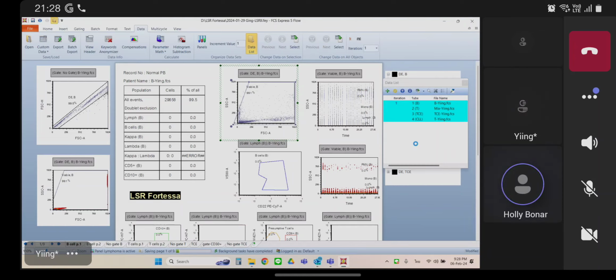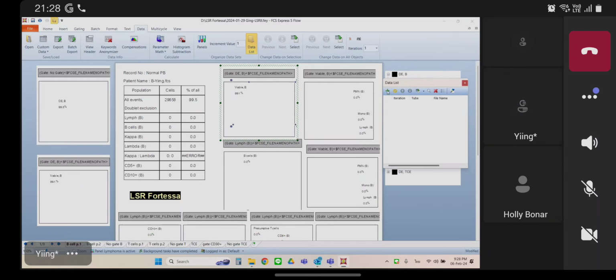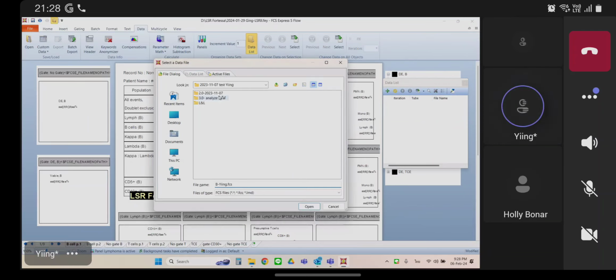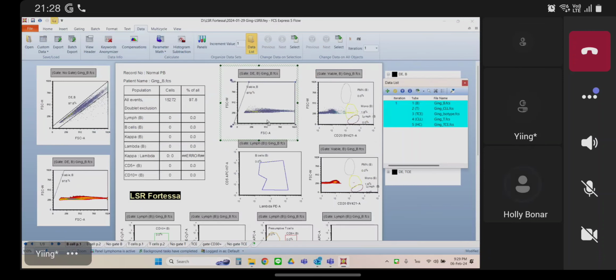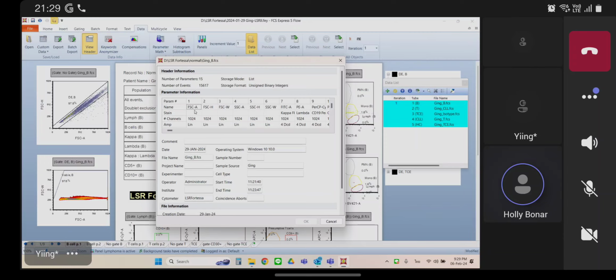Okay. So now let's remove this data and bring up the old data that doesn't work. Okay, now go back up to the header. See, now we're looking at forward scatter area versus forward scatter width. But remember, that plot is parameter 3 versus parameter 1. And the parameters got shifted because you have an extra parameter here.